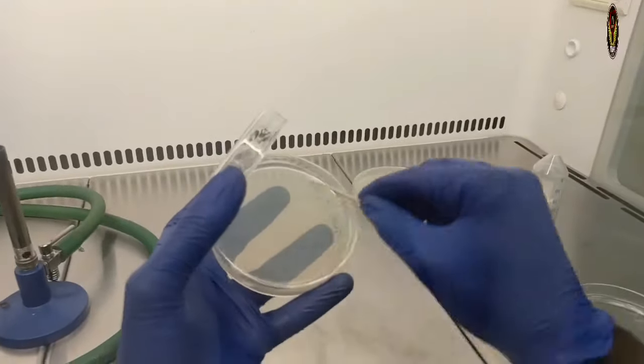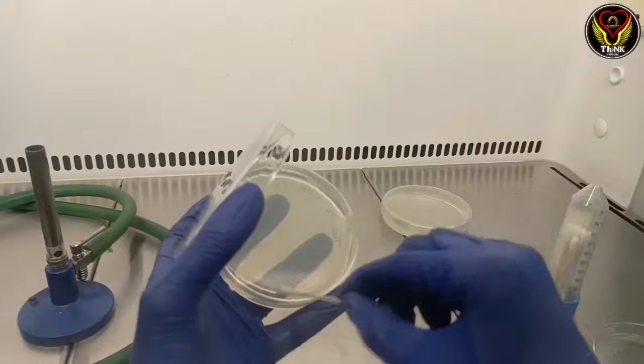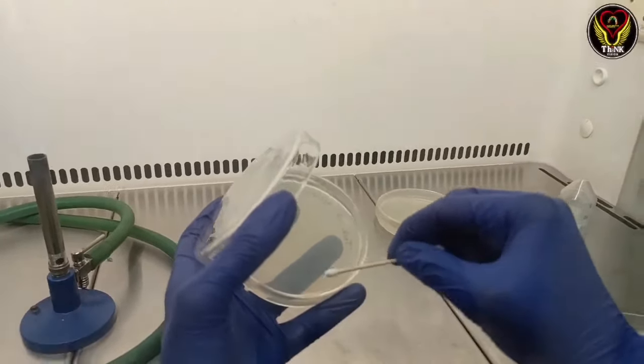And then we swab in the right direction. So we swab in 4 directions, rotating the swab each time.